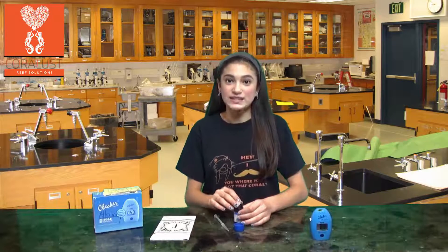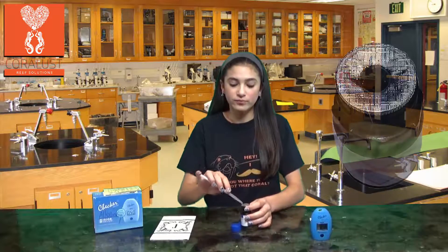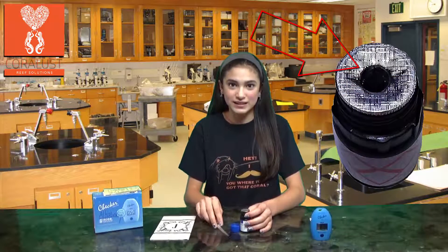Also, tip: if your reagent is new, poke a hole in the middle. Do not completely take it off.